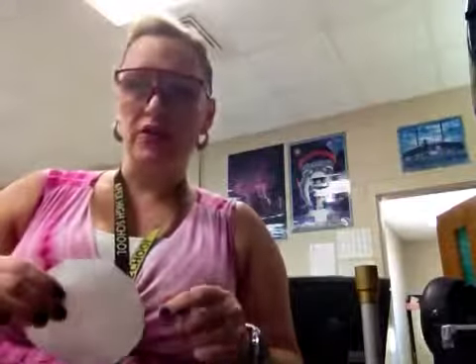Hi everybody, Ms. Venable here. Today we're going to talk about chemical reactions, and I'm going to do demonstrations for you on the chemical reactions lab. So you need your lab sheet and all of the materials. This lab is about chemical reactions, and so I want to make sure we understand the difference between chemical reactions and physical reactions.